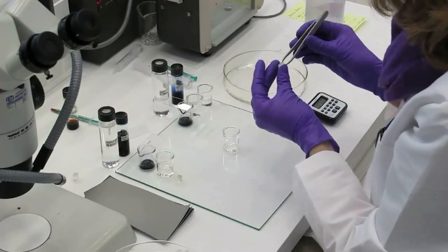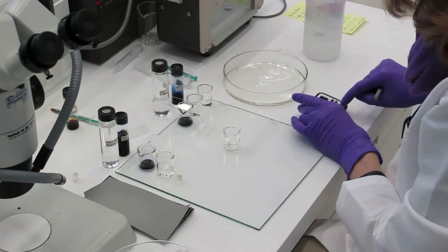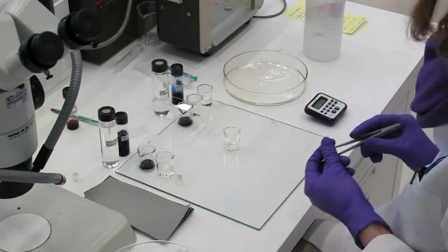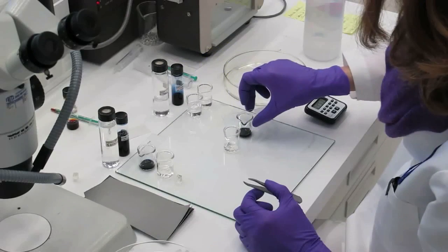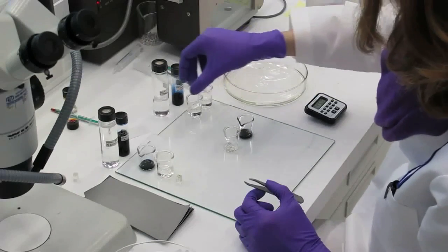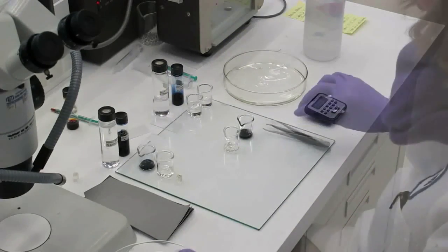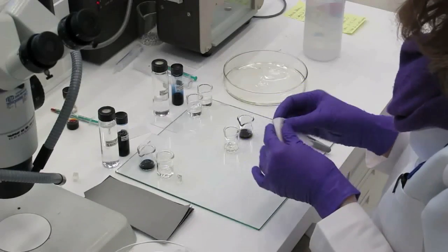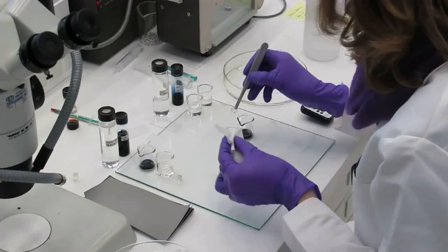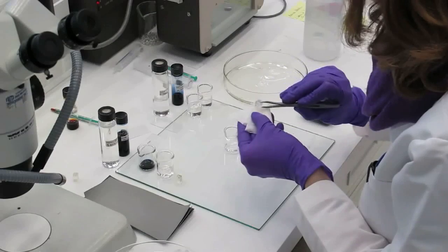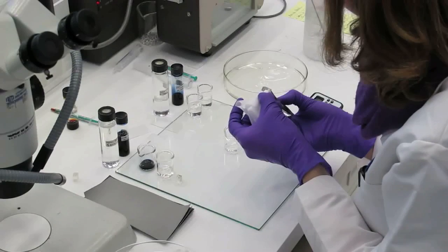As before with the protein staining, the sample cube is placed in the saturation bath for about 5 minutes. It is useful to set a timer so that the sample is not kept in the bath for longer than necessary, as some of the binding medium may be slowly dissolved. After 5 minutes, the sample can be removed from the bath, the excess solvent is wiped off, and the cross-section cube is placed in the stain, where it is left for 5 to 15 minutes.